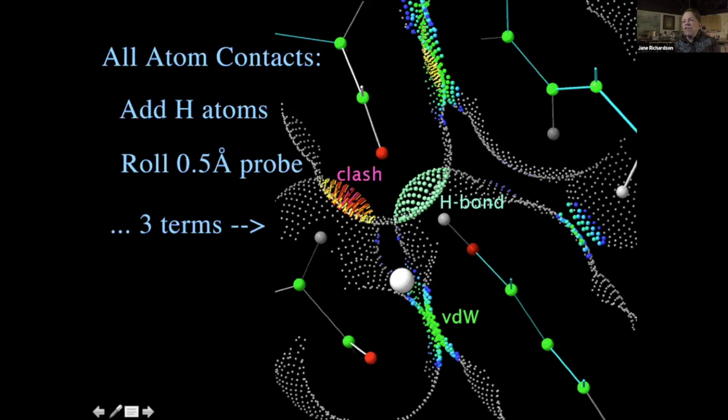And then we start showing hot pink spikes that we call clashes. And we hope that people would find those uncomfortable and want to get rid of them. I think we probably did that too thoroughly. You're always going to have a few left, maybe, that you can't explain away. In general, 0 is not the goal in outliers.